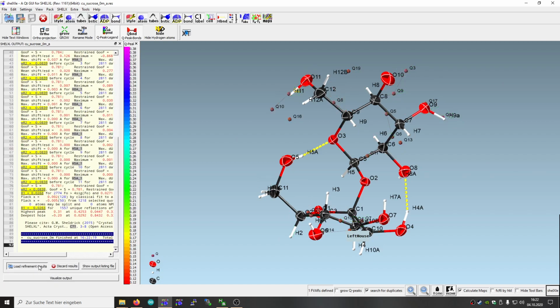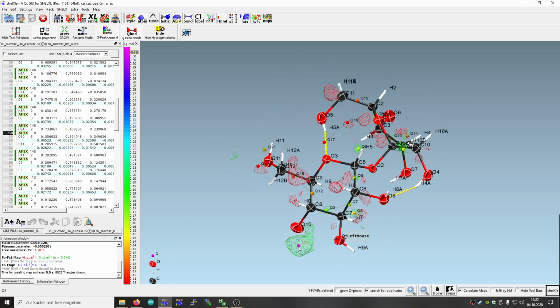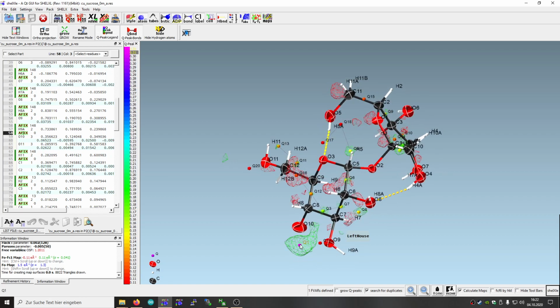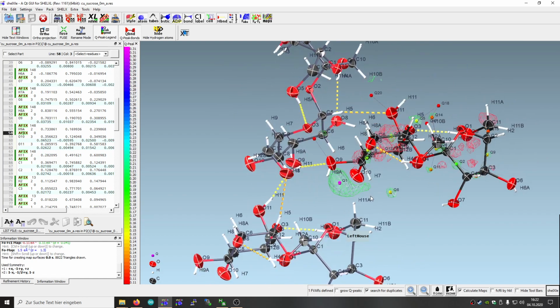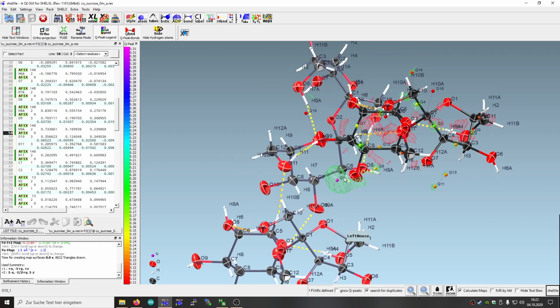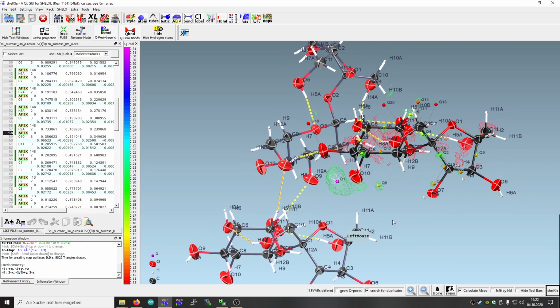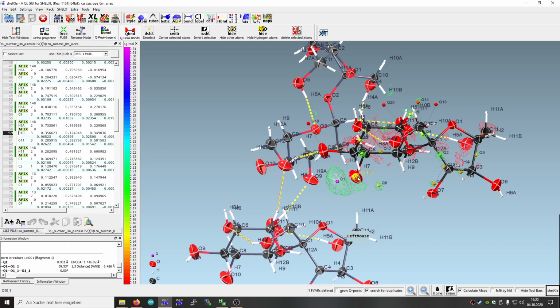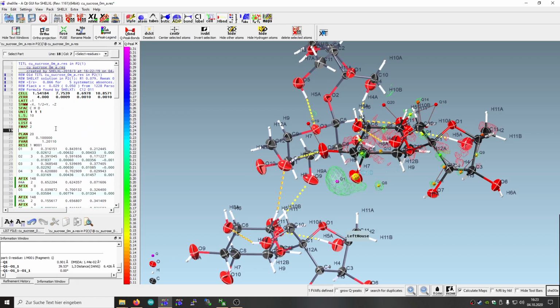So let's see. So we could repeat that forever. Sometimes the program is stupid enough to not find, even if there's a very obvious Q peak here, and this would expand to some hydrogen bond to another molecule. So that should give a nice hydrogen bond to O1 here. So I don't know why the program doesn't accept this, but this is resi 1, but there's only one resi, so we just use the old style editor.